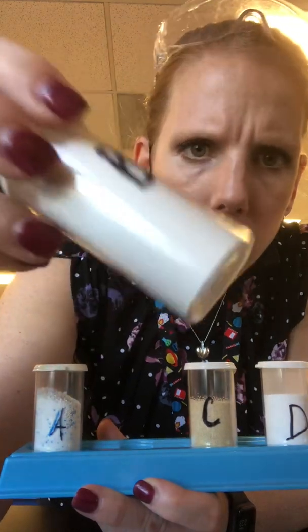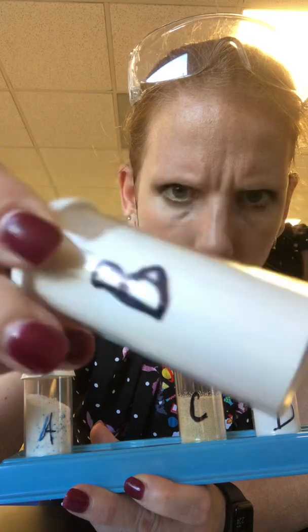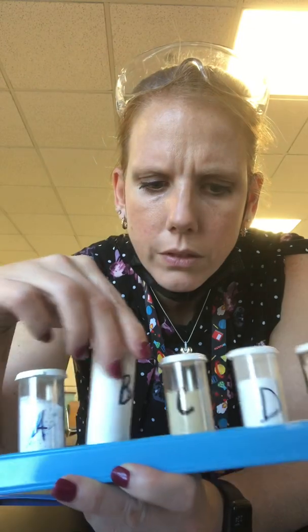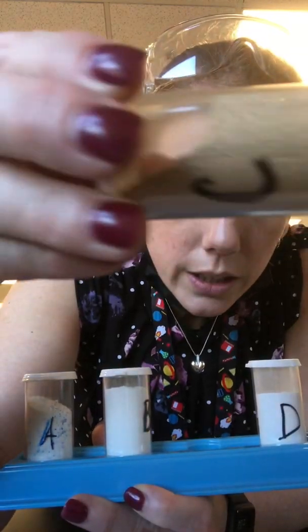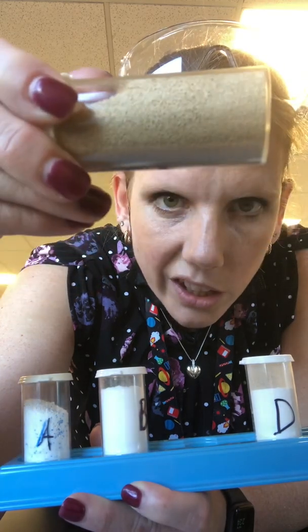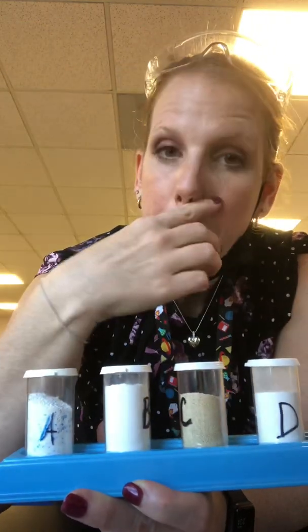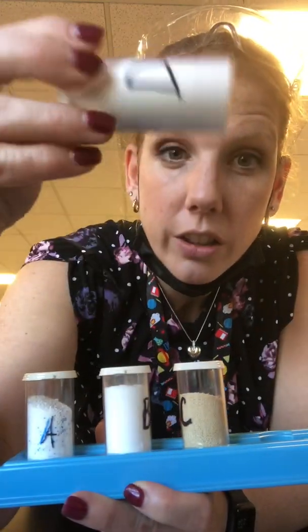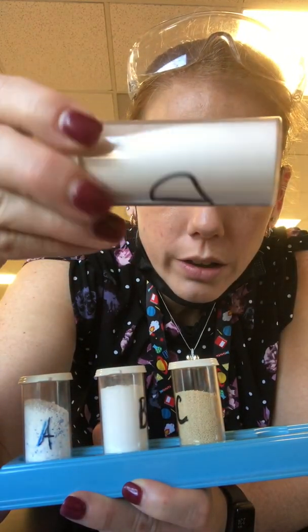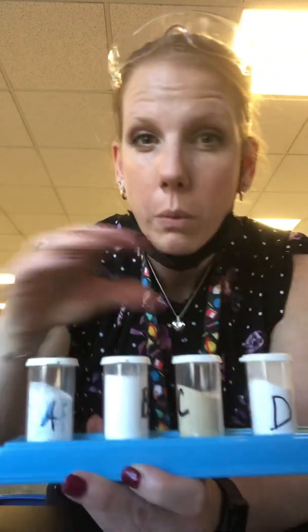This is B. B is also white, it's bright white. If you look closely, it's more of a very fine-grained powder. Okay, C is tan in color, and if you look closely, it almost looks like little sprinkles, okay? So I guess you'd have to say granular or sprinkly. And then D, again, is white and another powder. It's really thin, you can't see any crystals. Okay, so that's for part 1.